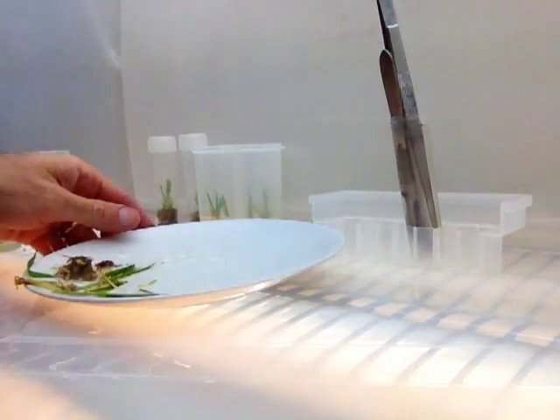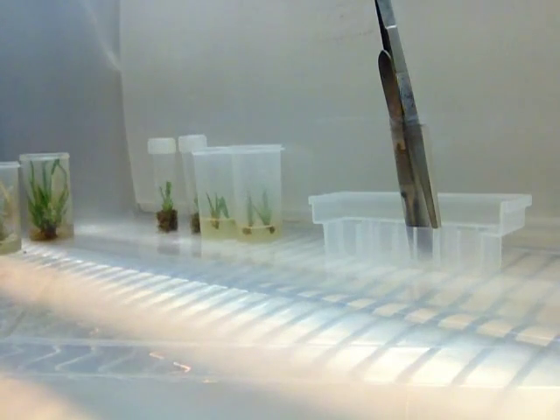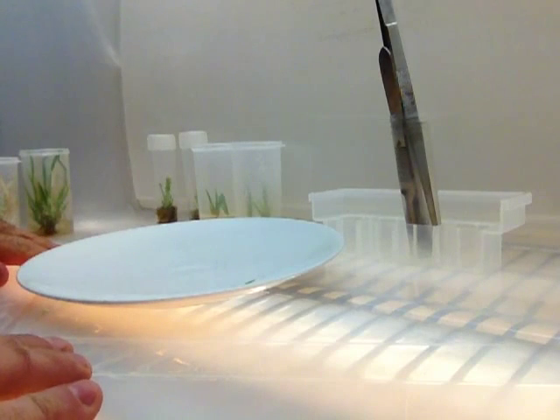The tool goes back in the alcohol. Now I'm going to wipe off the plate in the trash can using my leftover paper towel. And now I'm all ready to do this again. Alright, thank you.